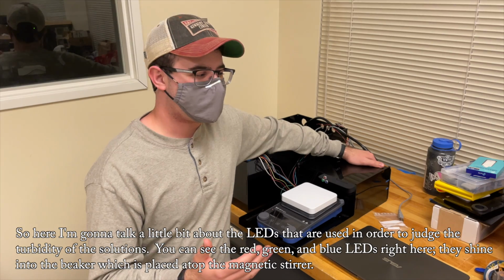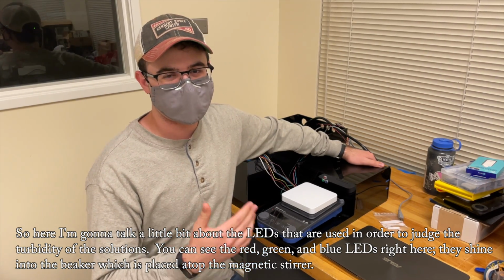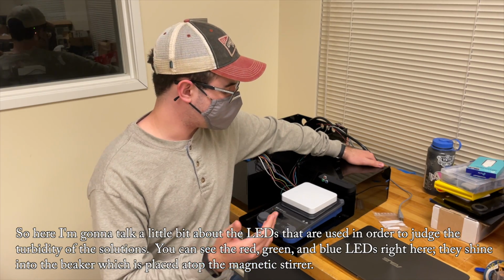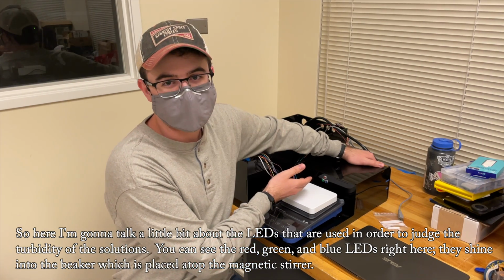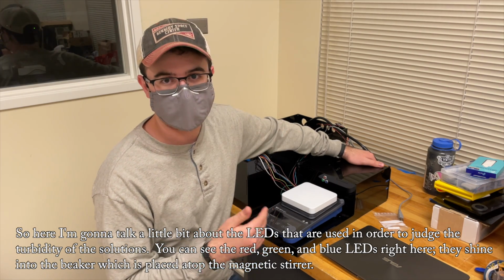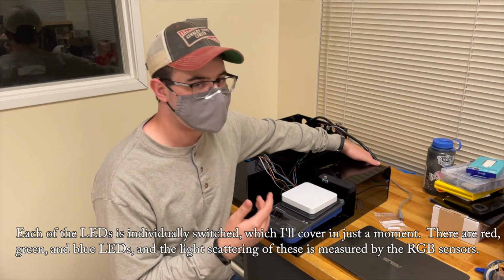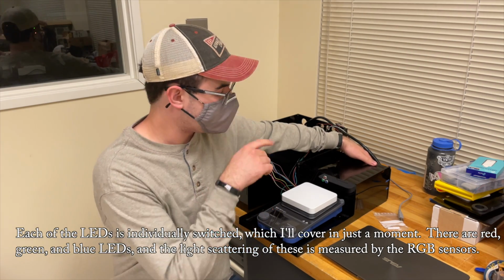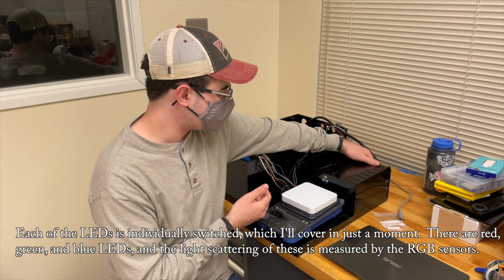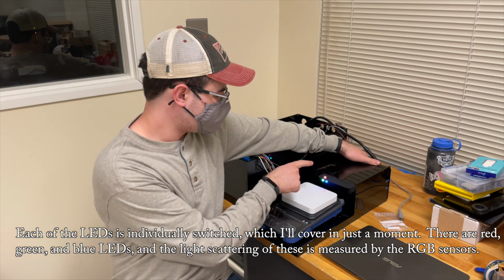So here I'm going to talk a little bit about the LEDs that are used in order to judge the turbidity of the solutions. You can see the red, green, and blue LEDs right here. They shine into the beaker, which is placed atop the magnetic stirrer. Each of the LEDs is individually switched, which I'll cover in just a moment. The light scattering of these is measured by the RGB sensors.